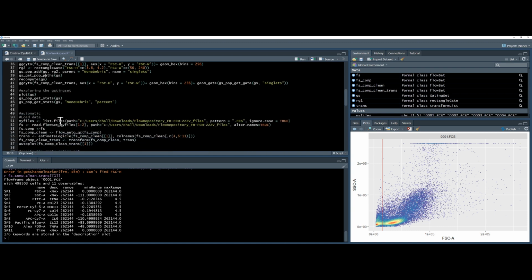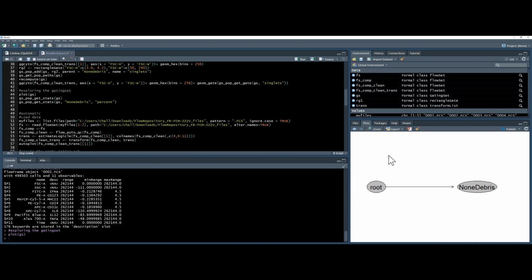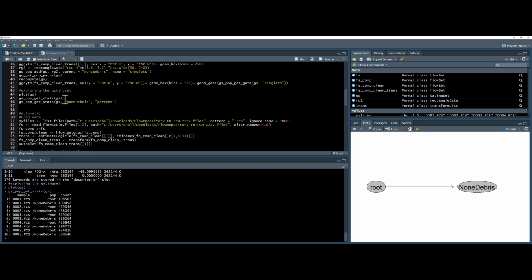Okay, so just before we go to automatic gating, which is probably what all of you want to do, there's a few more useful commands. If you type in plot on your gating set, it will produce a hierarchy of your gating structure. The statistics we've already seen, but there are other statistics you can do, and you can select certain populations and change the statistic. The default is count, and there's also percent, and you can also create statistical functions to apply to this, but we'll go through that later on.